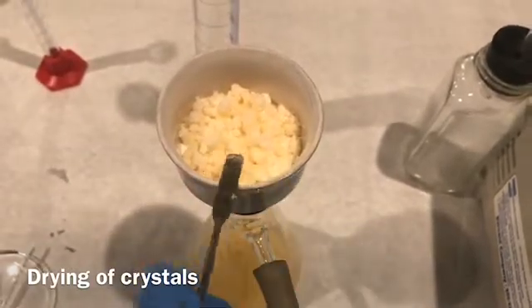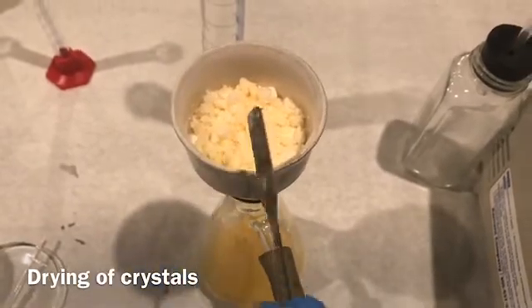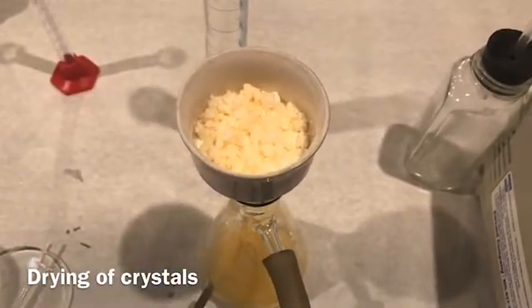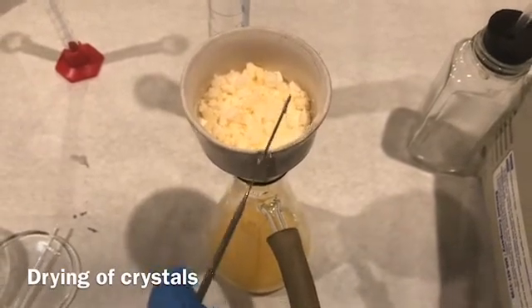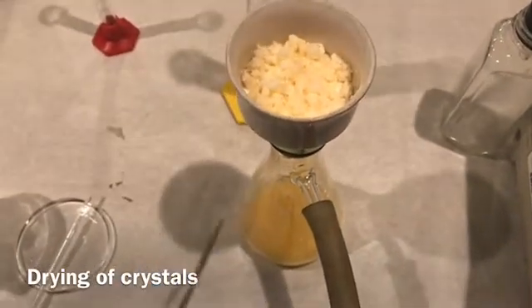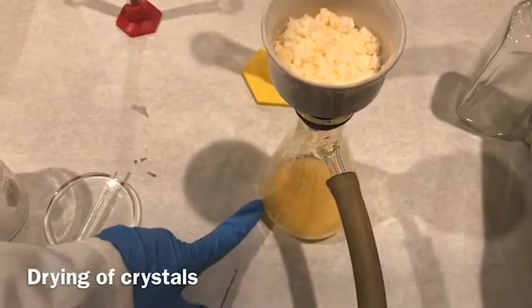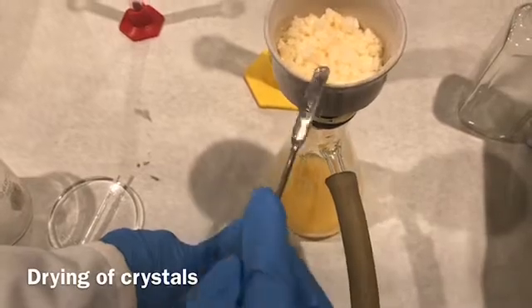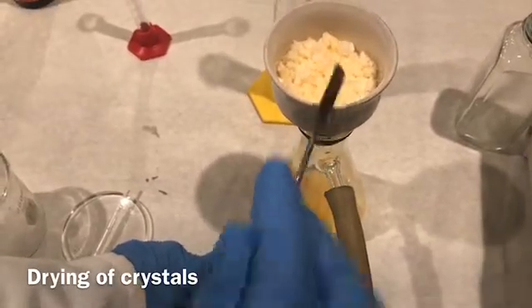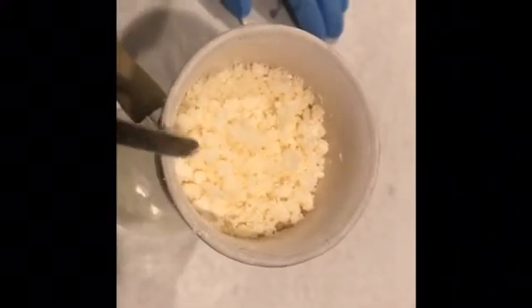I am going to let the crystals sit for five minutes on the Büchner funnel, then remove the filtrate and let them sit another five minutes. After that I will transfer them to the watch glass and let them dry completely overnight. This extra step is not in the lab manual, but I am doing it to enhance the efficiency of the drying process. After drying on the Büchner funnel it looks like this.